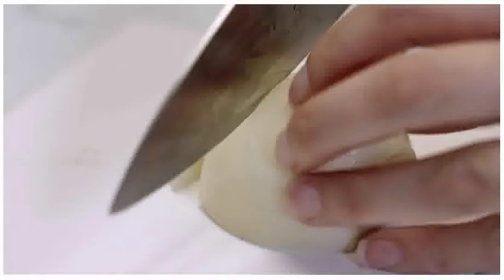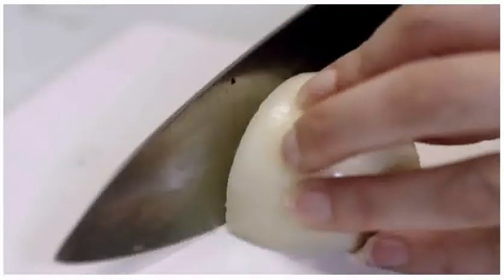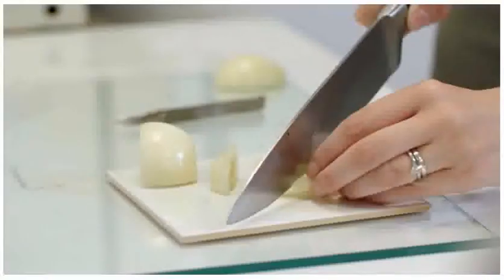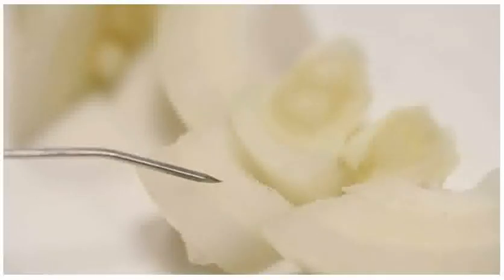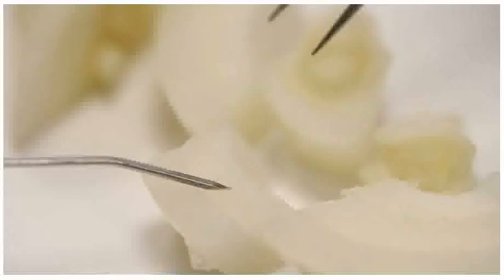Clean slicing motions are used to cut a slice about one centimeter thick. A small square of one of the onion layers is taken.